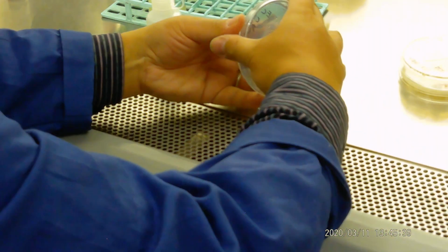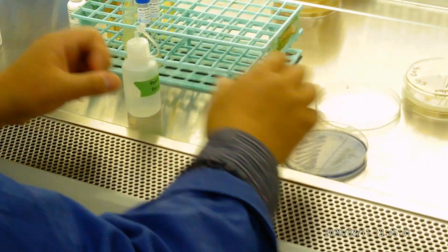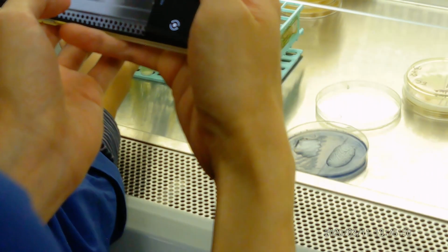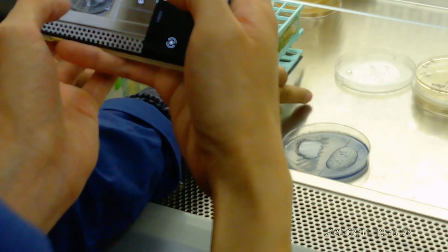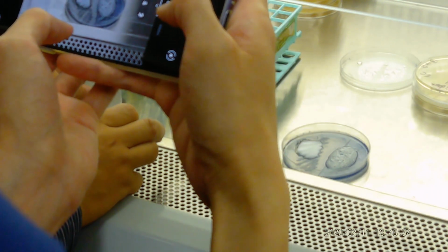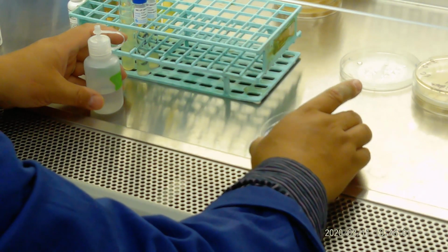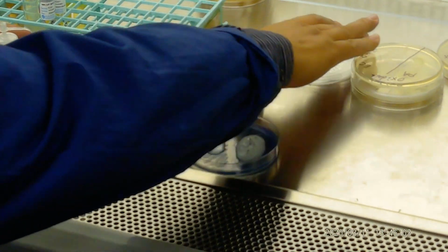Lee, just go inside and take a picture. See which one has a bubble. See the bubble? Yep, that means it's positive.